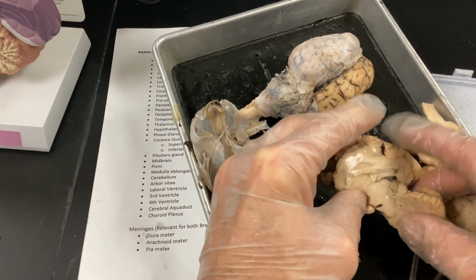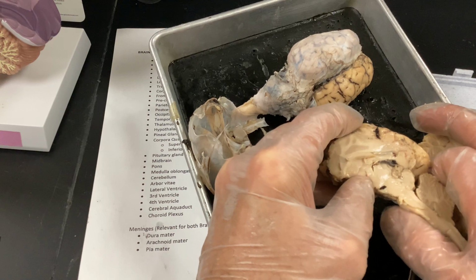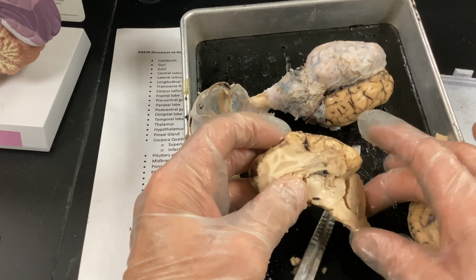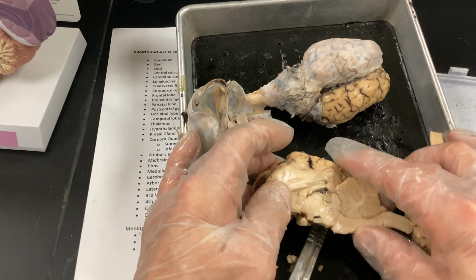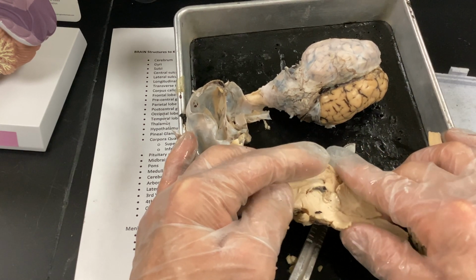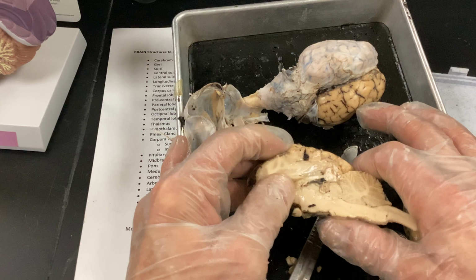And then up here, the outer part is your cortex. Cortex means covering, all right? And remember always, I said, week 1, if ever there's a medulla, there's going to be a cortex. Cortex means cap. So whether we're talking about the kidney, the adrenal medulla and adrenal cortex, or the brain, medulla and cortex come as a kit. It's like salt and pepper. You can't separate them, really.